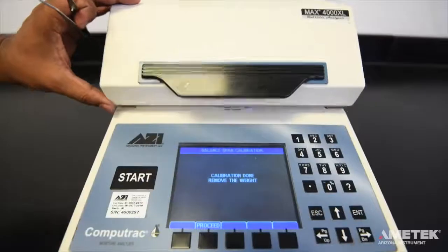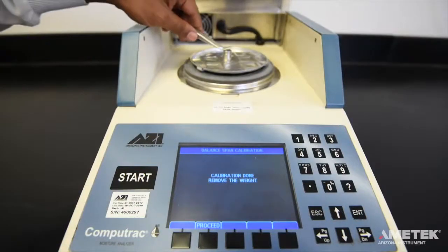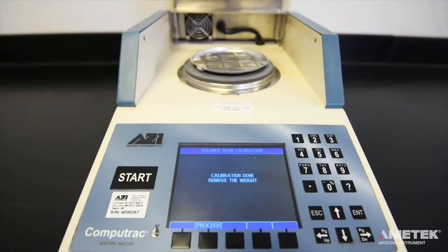Once the test has ended, open the lid and use the tweezers to remove the remaining weight. Remember, the heating chamber is now nearly 100 degrees Celsius, so take care not to burn yourself.